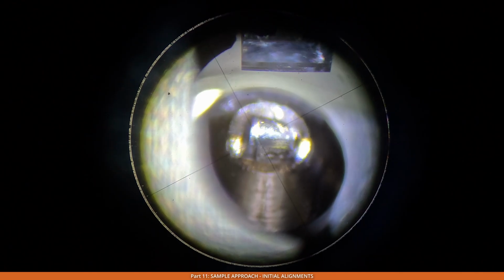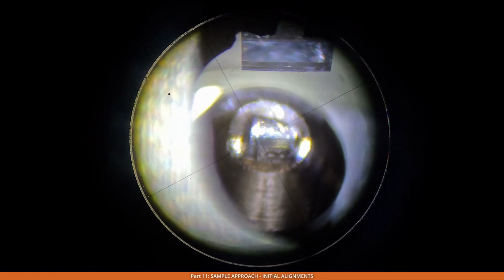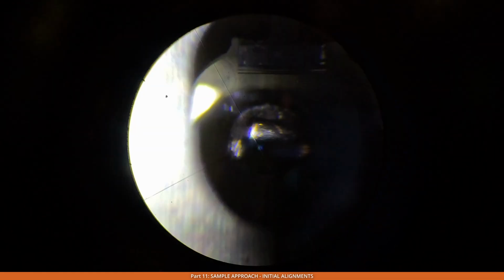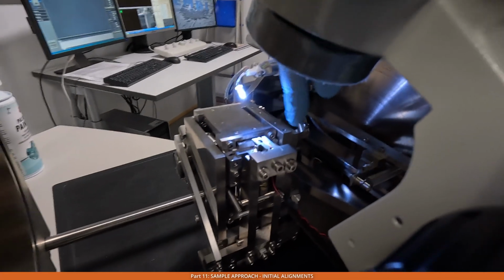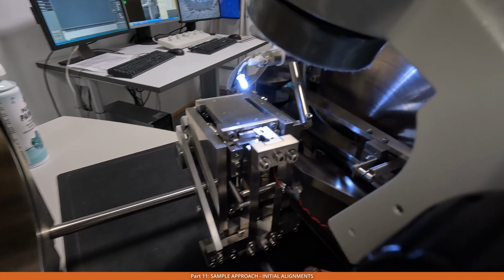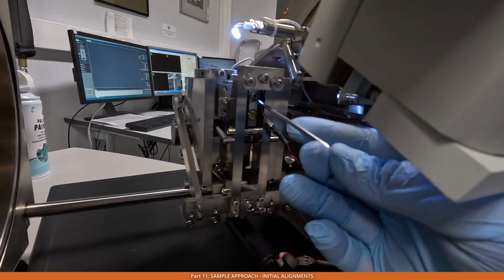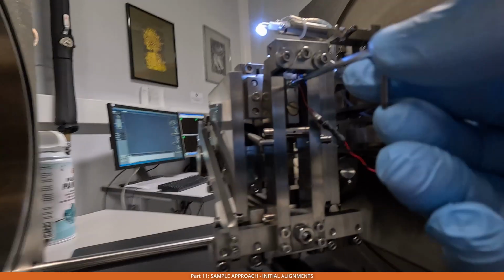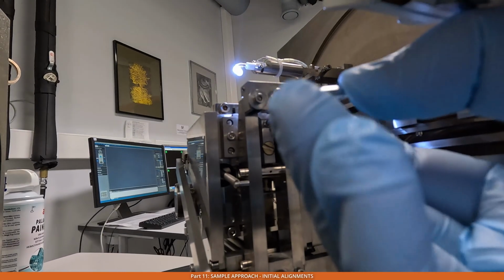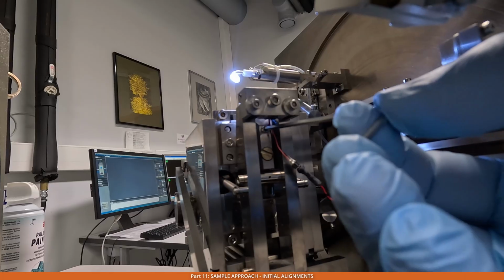Now we will rotate the sample so that the front face is perpendicular to the knife, and then after that we tighten it with the screw. Now I tighten the sample in the holder by rotating the screw, which is just above the big screw for the screwdriver.